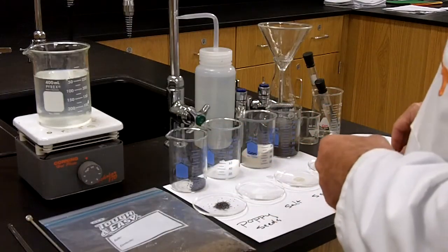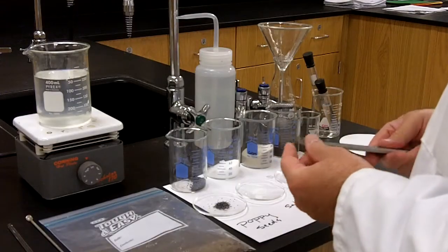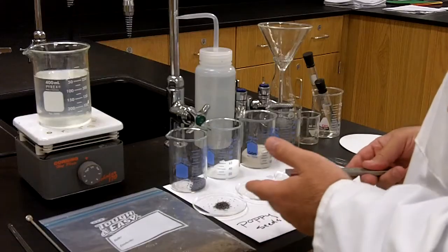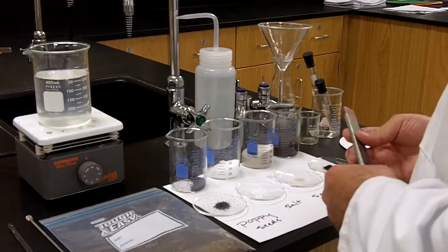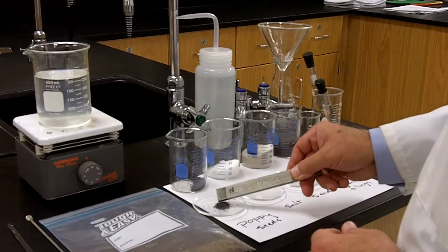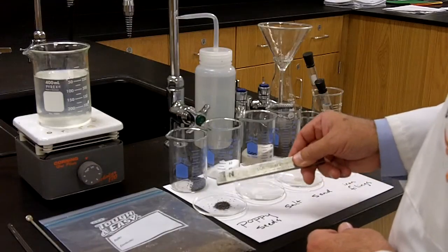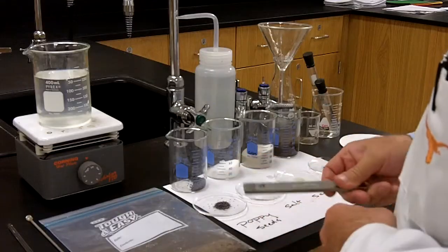One of them is going to be a magnet, like this one. So this is a bar magnet, and you're going to be using this bar magnet to help separate these. So let's take a look at what the bar magnet does to each one of these substances. If I place the bar magnet here, I'm not sure if you can see that on camera, but I will tell you that the poppy seeds are not in any way attracted to the bar magnet. There's no remnant of poppy seeds on the bar magnet.